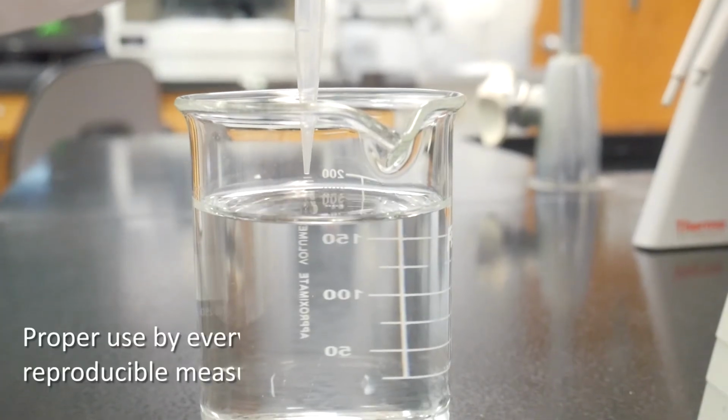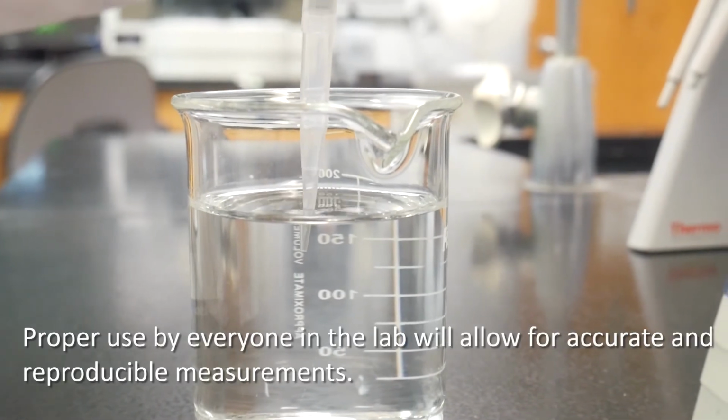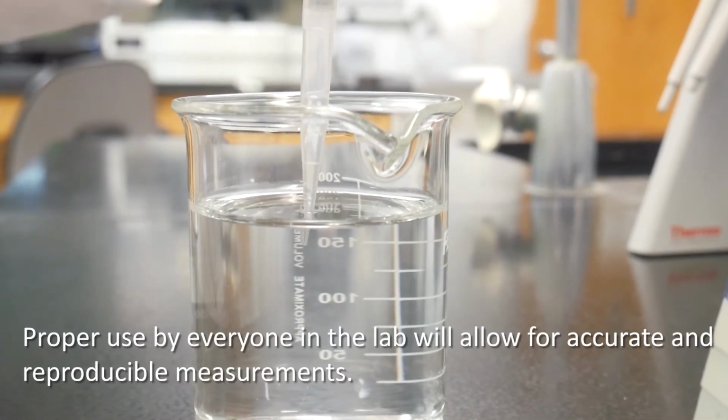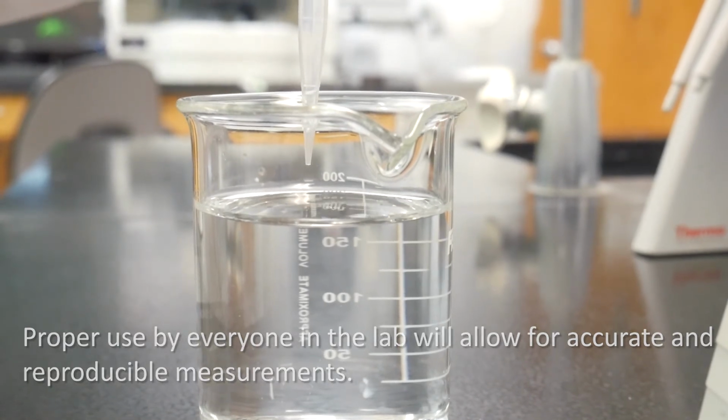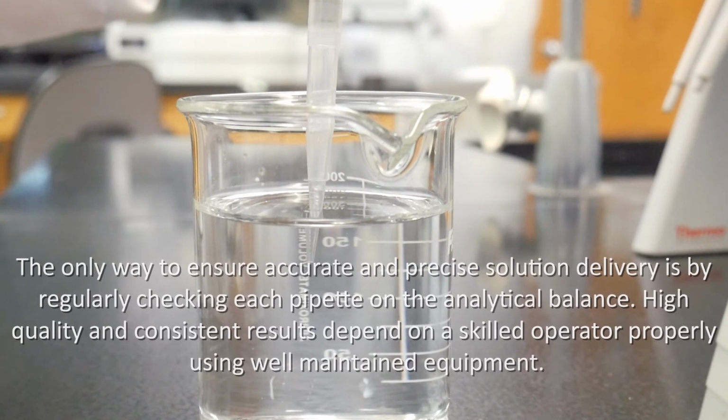As you can see, it takes very little to cause a micropipette to become inaccurate. Proper use by everyone in the lab will allow for accurate and reproducible measurements. The only way to ensure accurate and precise solution delivery is by regularly checking each pipette on the analytical balance. High quality and consistent results depend on a skilled operator properly using well-maintained equipment.